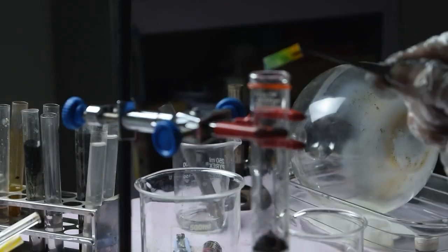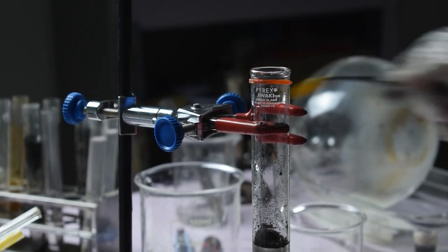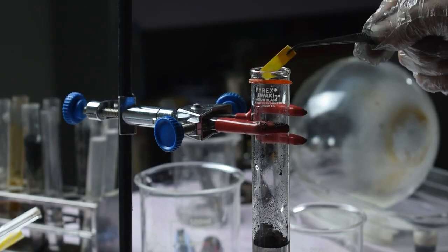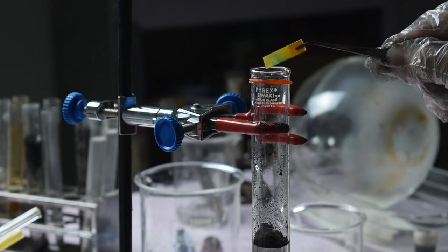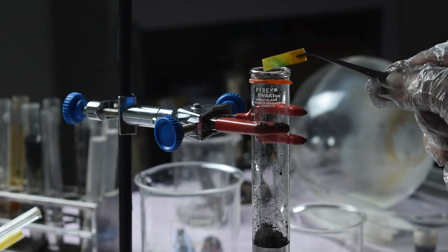As we've seen, the chemicals inside an ordinary zinc-carbon battery can be used, with the appropriate reagents, to generate three different gases: hydrogen, oxygen, and ammonia. This demonstrates the fascinating chemistry hidden inside a common household battery and provides a practical insight into the chemical composition of a zinc-carbon cell.